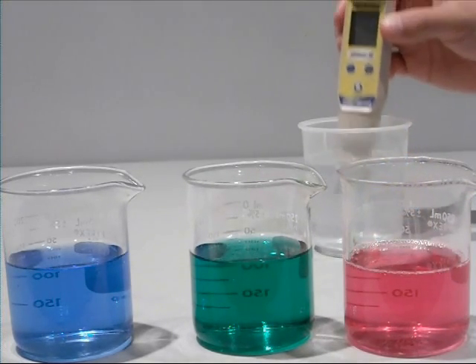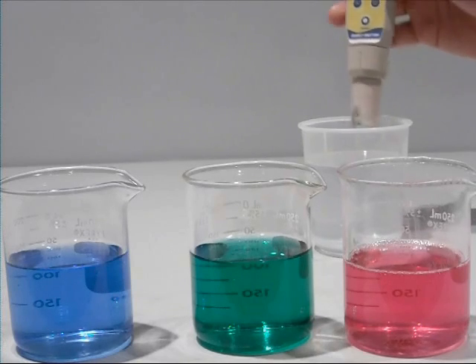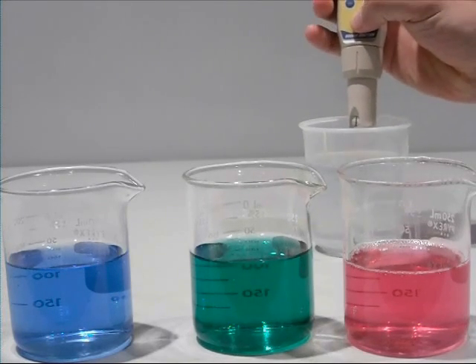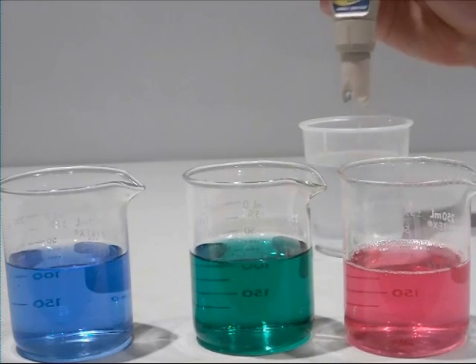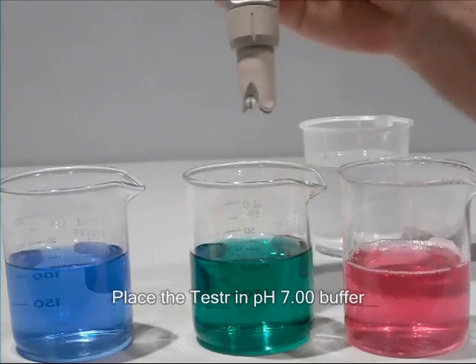Before calibrating, rinse your pH electrode, press the ON-OFF button to switch the unit on, and then place the electrode in pH 7 buffer solution.